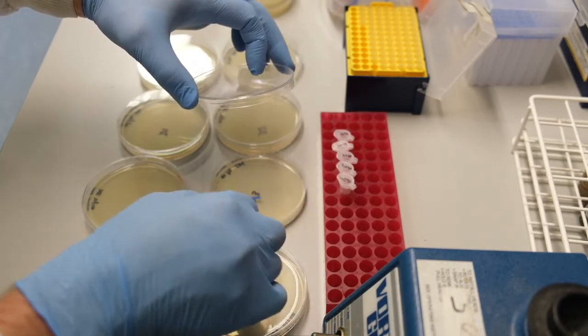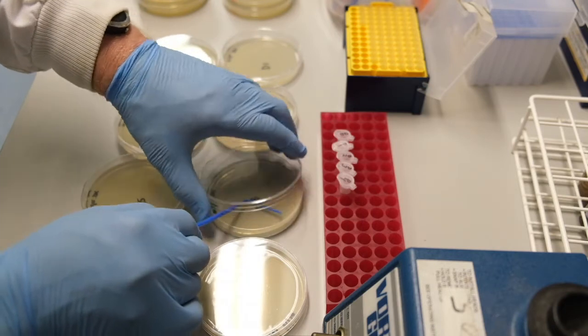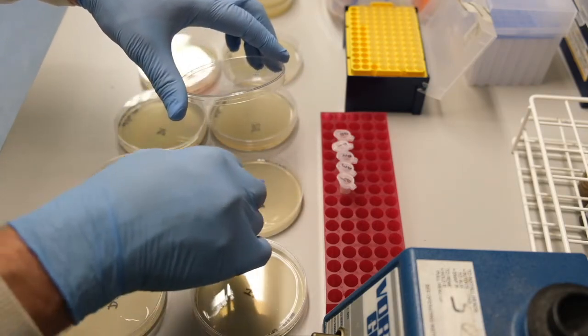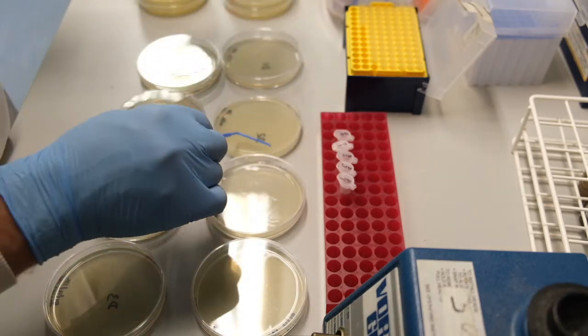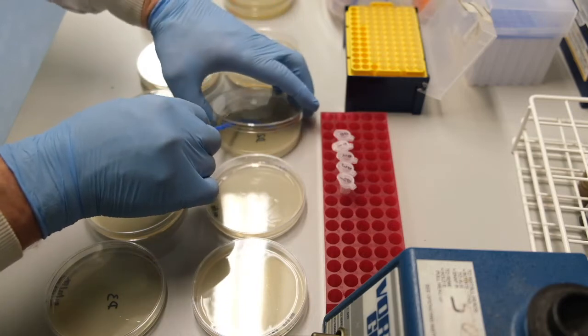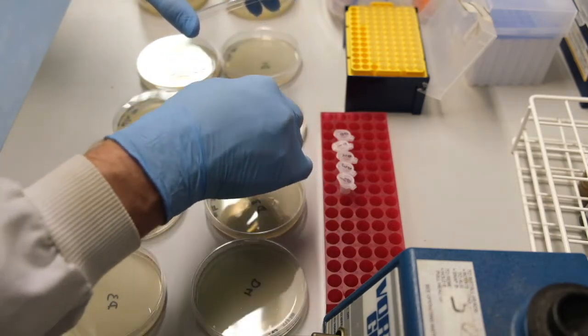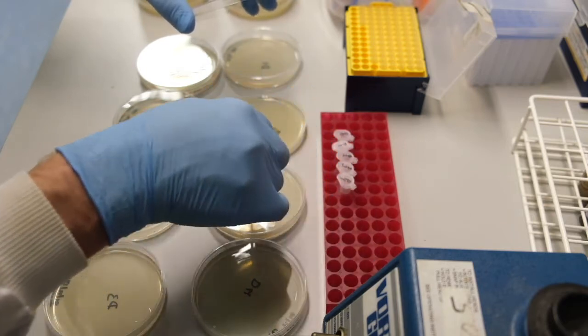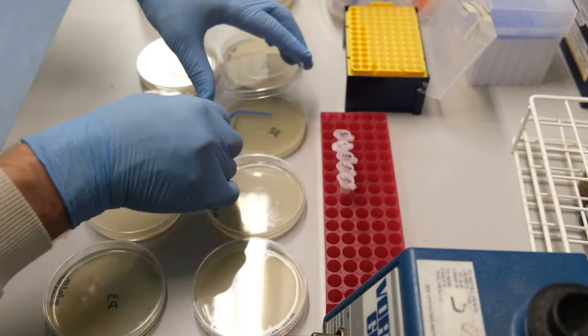You can reuse the same spreader as long as the cells are the same each time and you are increasing in concentration. You will only carry over a very small amount of cells over to the higher dilution. Remember to turn the plate after doing each set of spreading. Try to get the spreader into all of the corners of the plate.